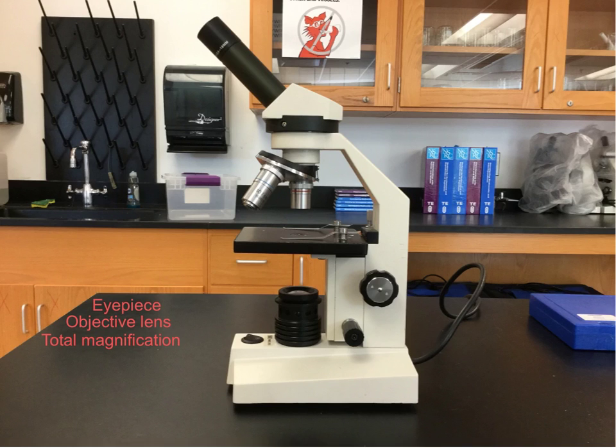Holding up the upper part of the microscope is the arm. You also use the arm when you're carrying the microscope with one of your hands. Beneath the arm, you have the stage. The stage is where you place your specimen under view. On top of the stage are the stage clips, which hold the glass slide in place.